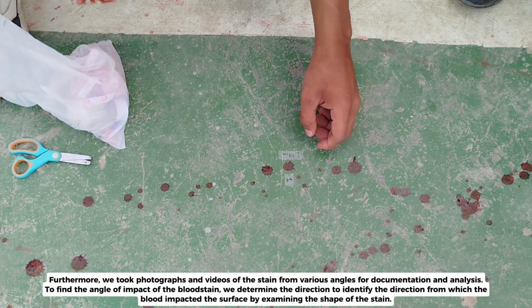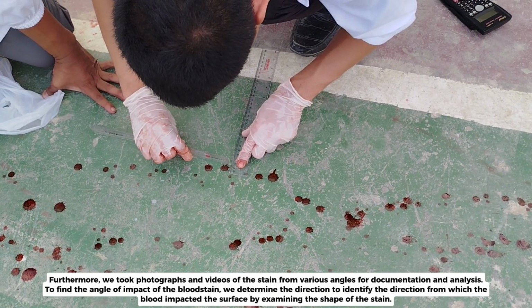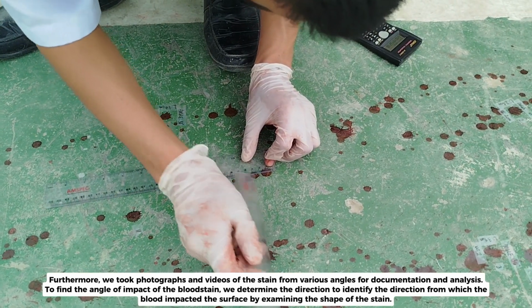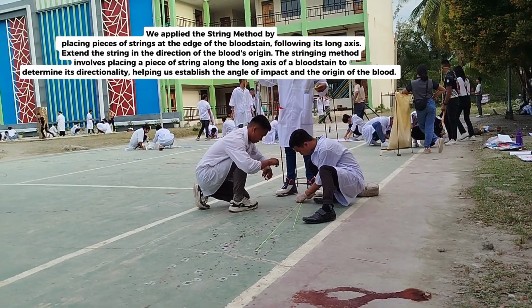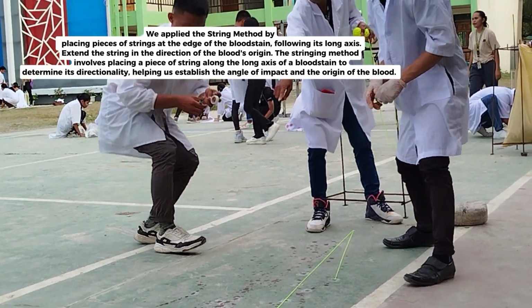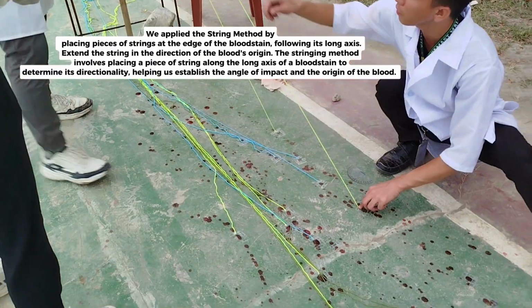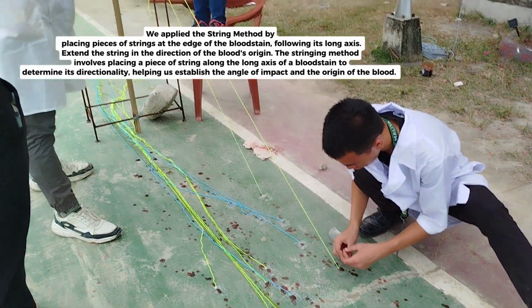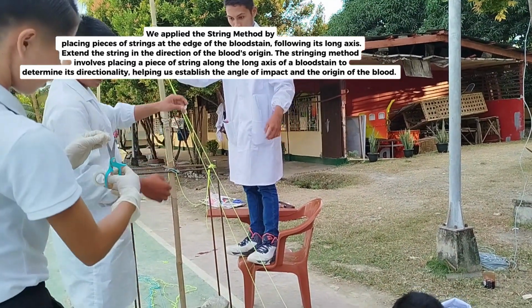To find the angle of impact of the bloodstain, we determined the direction from which the blood impacted the surface by examining the shape of the stain. We applied the string method by placing pieces of string at the edge of the bloodstain, following its long axis. Extend the string in the direction of the blood's origin. The stringing method involves placing a piece of string along the long axis of a bloodstain to determine its directionality, helping us establish the angle of impact and the origin of the blood.